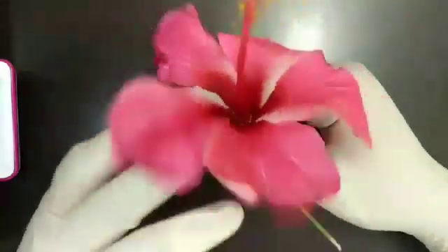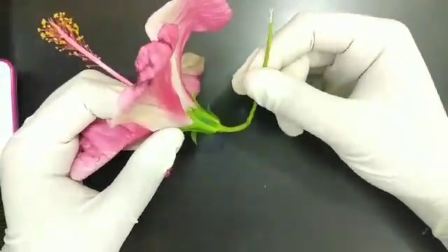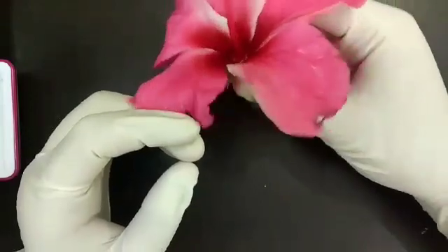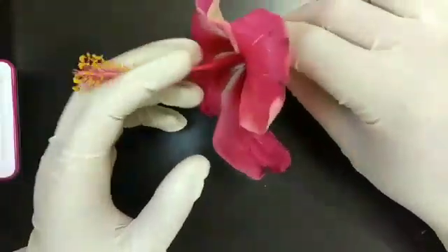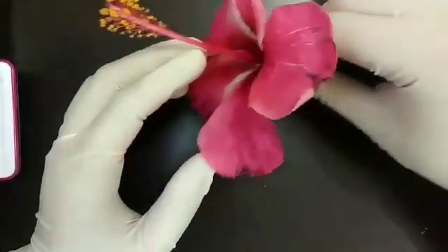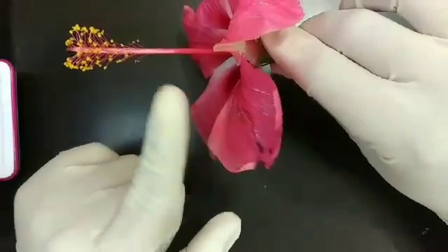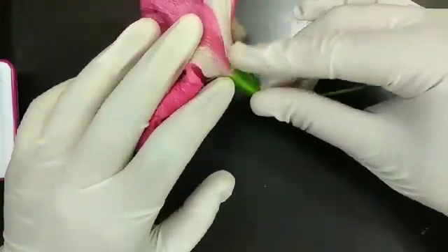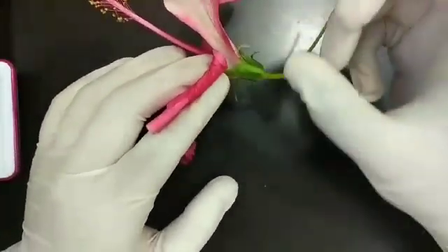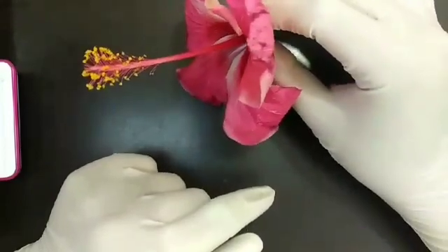Now in this experiment, first of all we are going to remove the sepals, which is the green part of the flower. After we remove the sepals, we are going to remove the colored part of the flower — yes, the petals. After we detach the petals, we are going to split open the style of the flower to detach the ovary. After that, we will needle the ovary to get the numerous ovules, and then our dissection of the hibiscus flower will be completed.